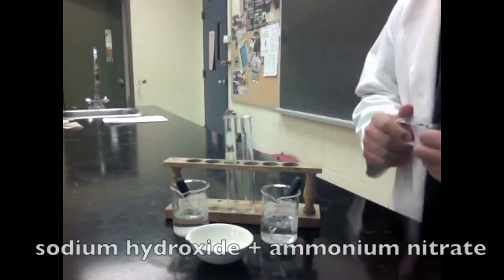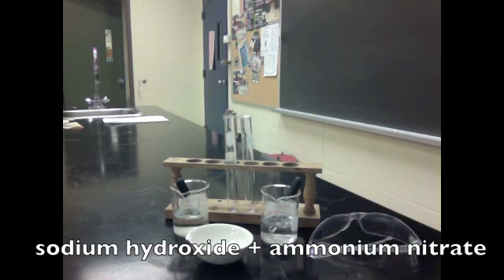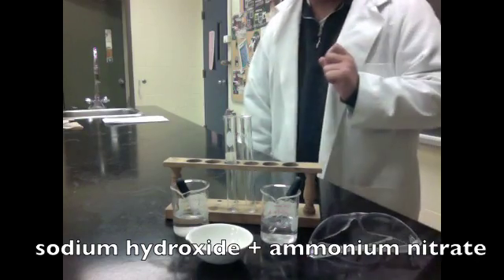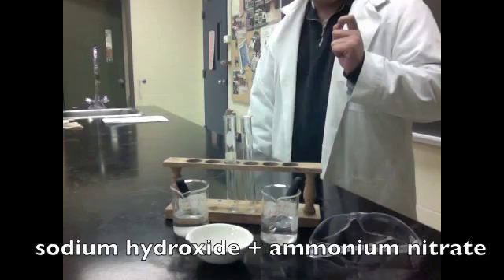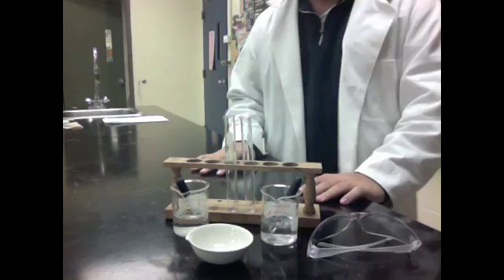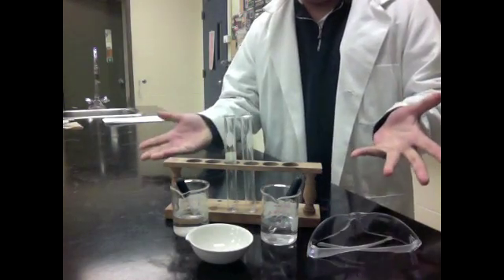Well, today, as you can see, I did pick out a couple things before I left class. And I happened to pick out two test tubes, sodium hydroxide and ammonium nitrate. And this experiment is called the sodium hydroxide and ammonium nitrate station experiment.